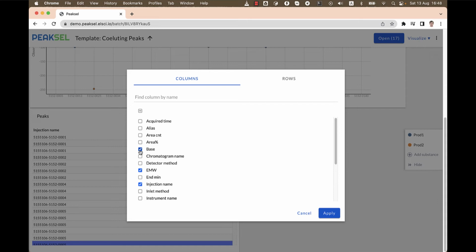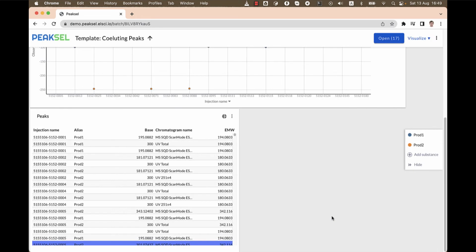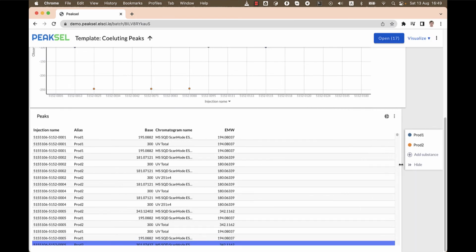Just to add more context to the information, I will add the alias of the substance. And also, for reasons I will go into later, we will add the chromatogram name. The rest of the information is not relevant to this chart, so I will not include these columns. Here's our data. As you can see in the first row, the EMW and the base differ by 1, which is expected since the compound was ionized by H+. In some other rows, the values are quite different.